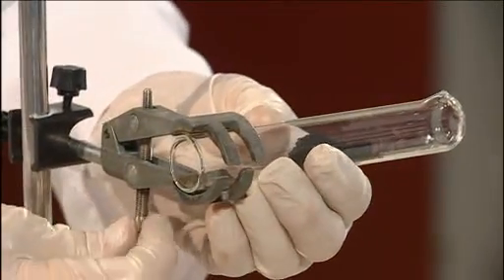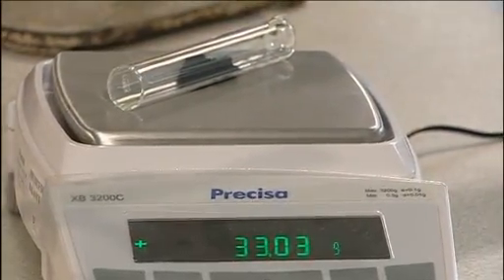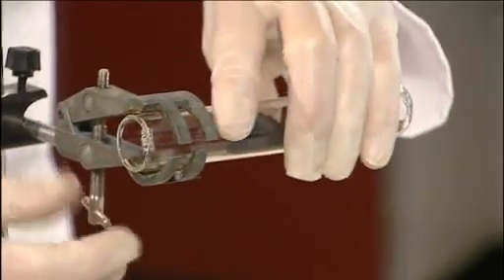Having put the copper oxide into the tube, we re-weigh it. The copper oxide should be dry. Old stock may need to be dried in an oven or desiccator.